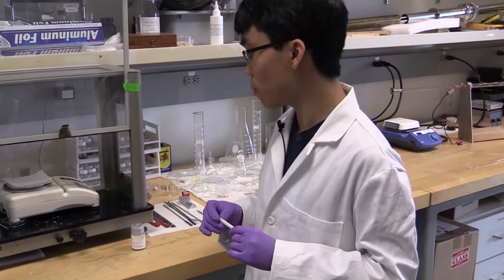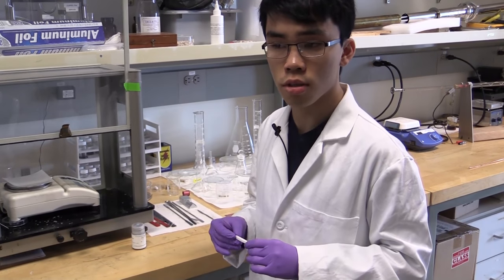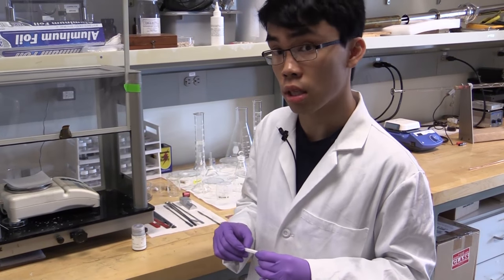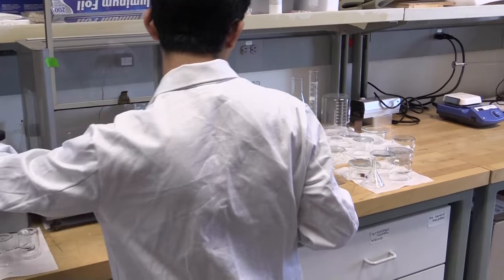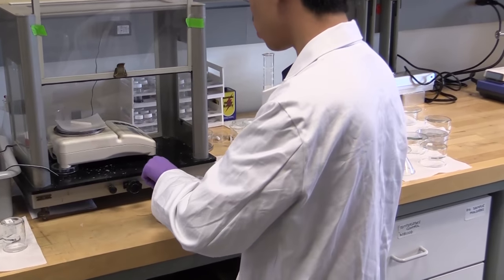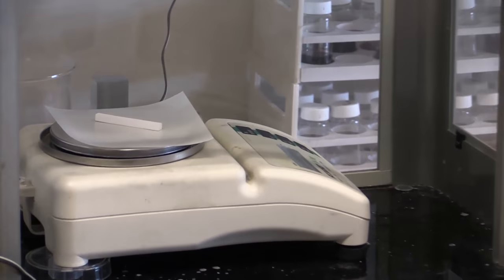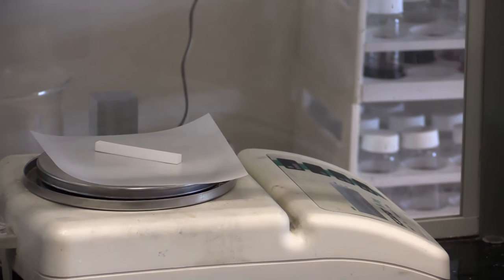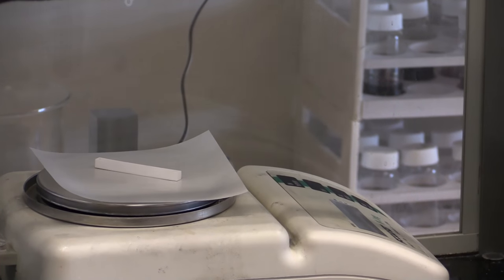And here is the crucible. We are going to weigh out about 80 milligrams of tungsten oxide source and 30 milligrams of tungsten selenide source. The tungsten oxide will provide additional tungsten source to our substrate, since tungsten itself does not sublimate very readily at 950 degrees.